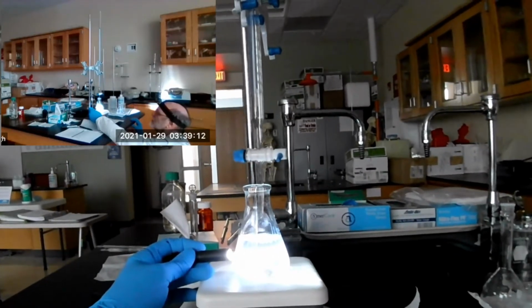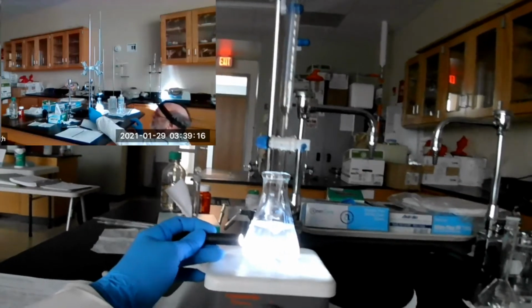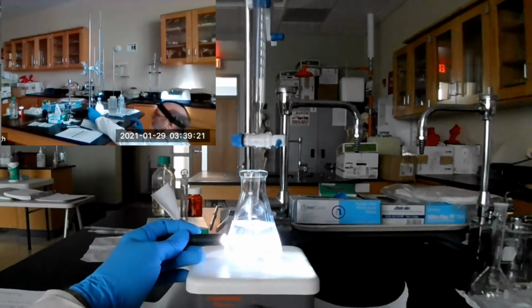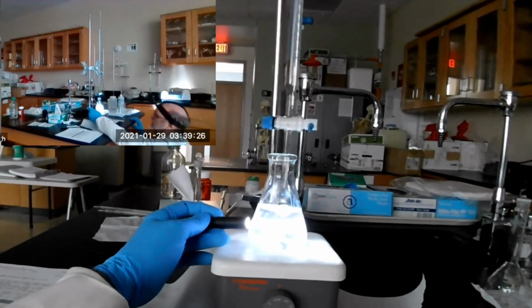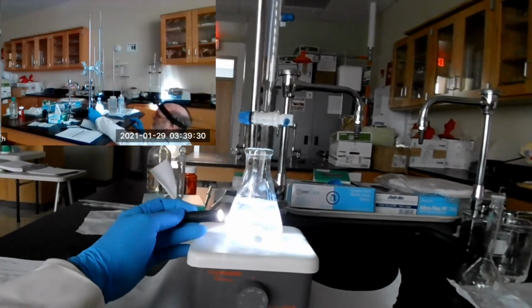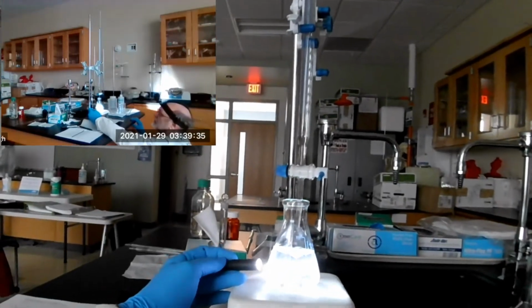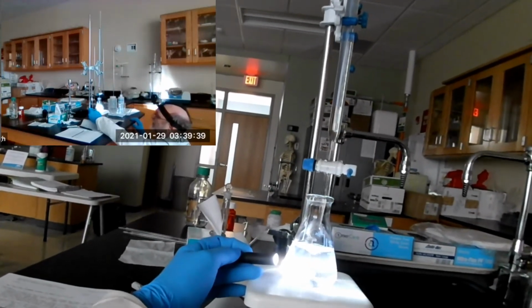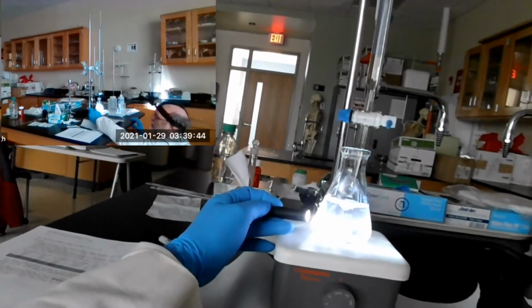It's still there. We might have it. This might be the end point. Let's give it a minute or two, see if it fades anymore. If the opalescence persists, if the Tyndall effect is seen, it does not go away, and I'll rock the beam so you can see it moving up and down, hopefully. I think we might be there. Yeah, it should have been gone by now, I would think.